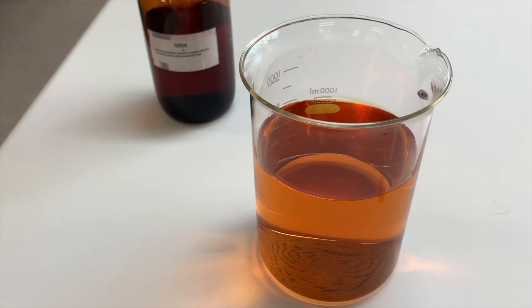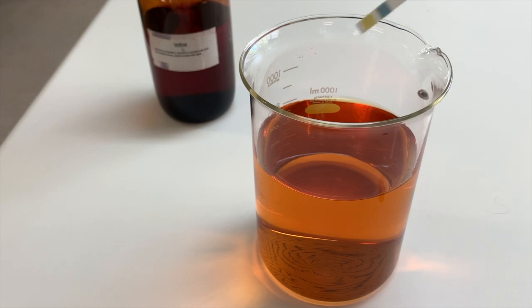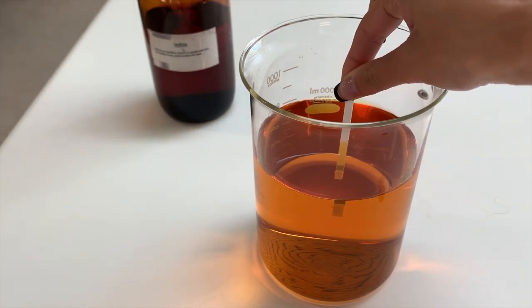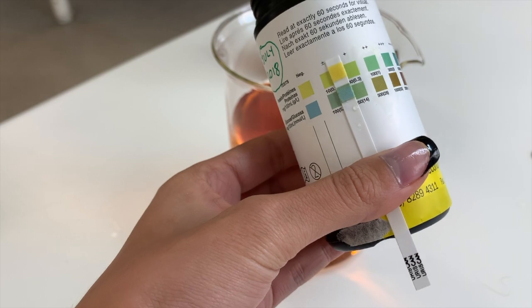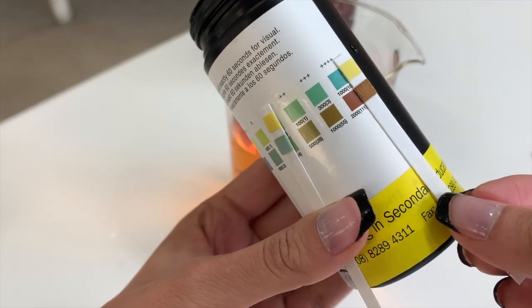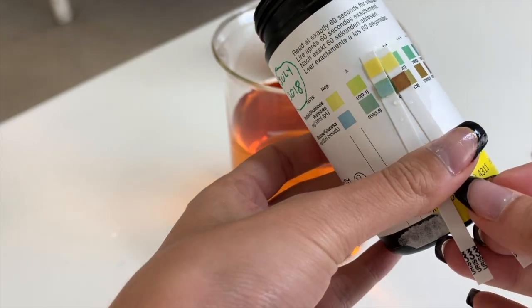Just as we tested for the presence of glucose within our glucose starch solution, we need to test our iodine mixture as well. So we use our glucose strips here, so we can see that the little box is blue, and we are not expecting there to be any glucose in this solution. So here we have both of our strips. The strip on the left is taken from our iodine solution, and the strip here on the right is taken from our glucose starch, so we can compare the levels of glucose initially.